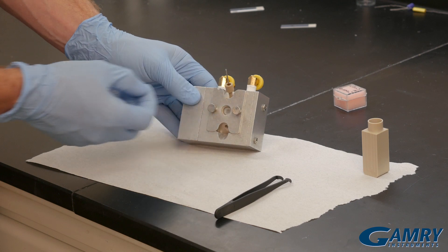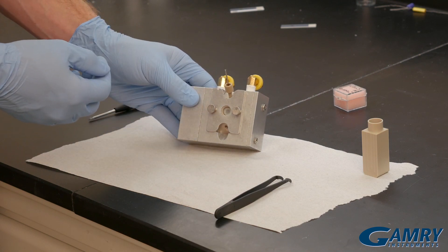This platinum tube serves as our counter electrode in case we need to do an electrochemical experiment while flowing solution past.